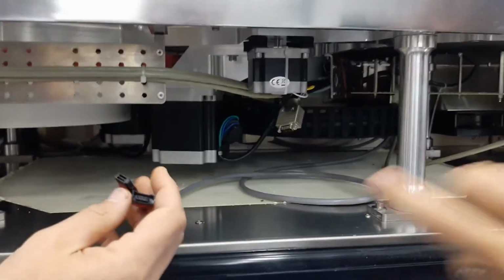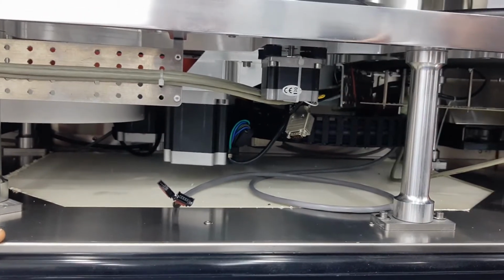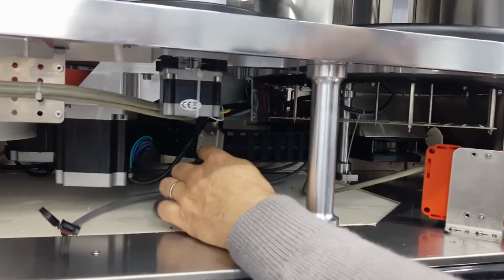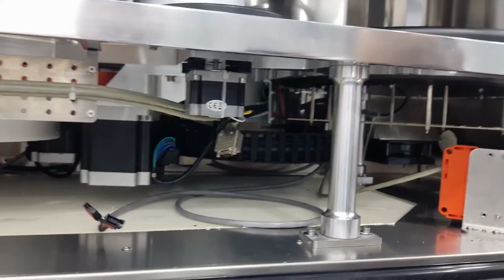And these cables? No. These ones? This ones? They're for the controls. That's for the 2 buttons on the panel. We're gonna plug them back: the light and the door button. And then those 2 are for the barcode reader, which is not installed. Okay. So it's left open.